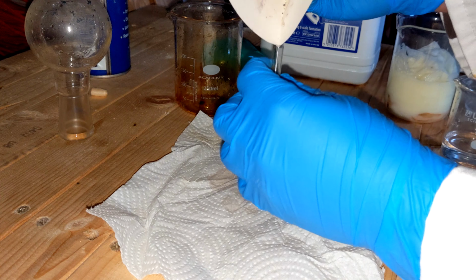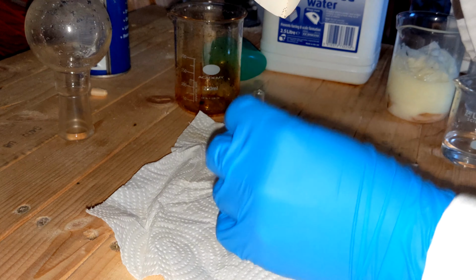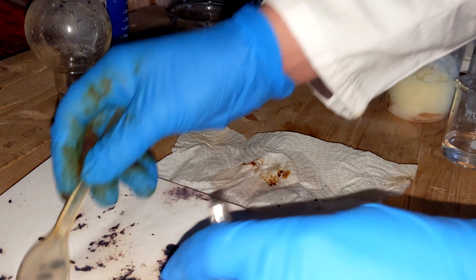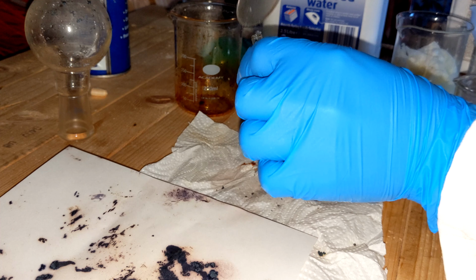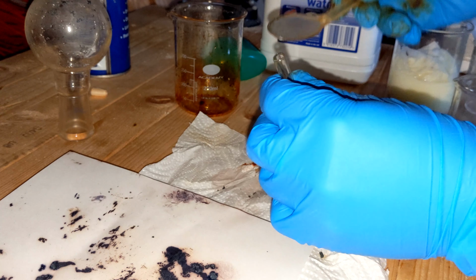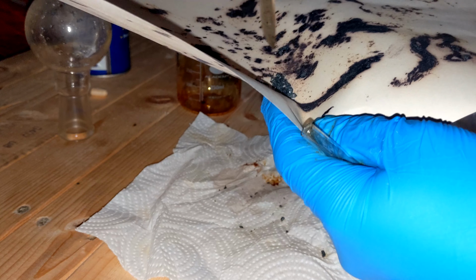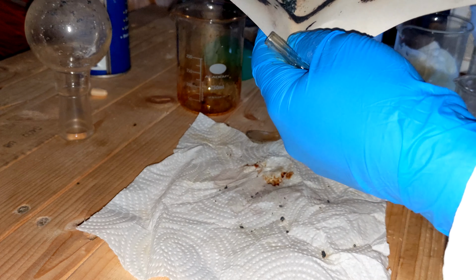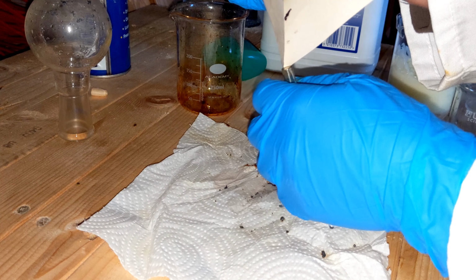Right, so now I try and transfer it all into an ampule I made, and it's spilling everywhere. It was raining when I did this, so the air was very humid, so the filter paper was damp, like everything was damp, the iodine was damp, and it soaked into the paper somewhat. I really should have used some sort of grease-proof baking paper or something like that, because you can see how floppy and wet the paper is, and how the iodine has stained it. So I try and put it all into this ampule. I'll probably speed up this whole thing again.